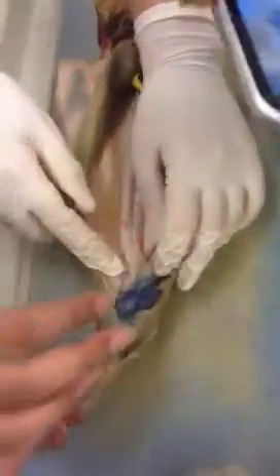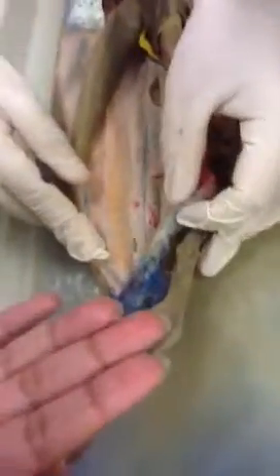And the ones down here you can't really pin. You could the rectal gland, but the cloacal arteries and all of that, since it's such a big blue mess, you can't really pin it.